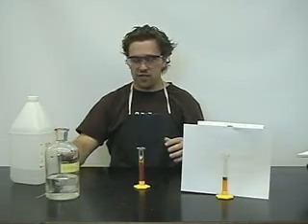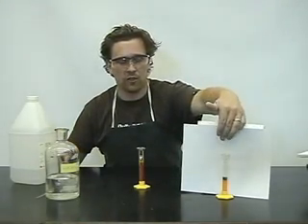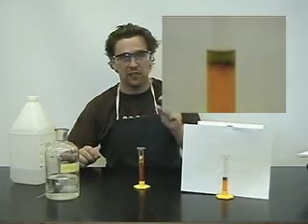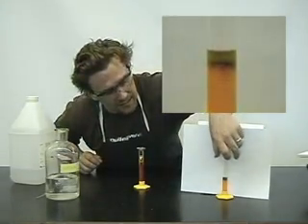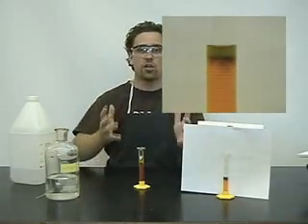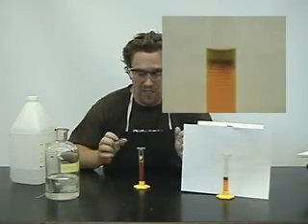I'd like you to pay attention here now to the solution. What I'll do is I'll zoom in on it and it'll pop up on the screen. You'll notice definitely the difference in layers. You'll see the top layer is a dark green. That's pretty cool.